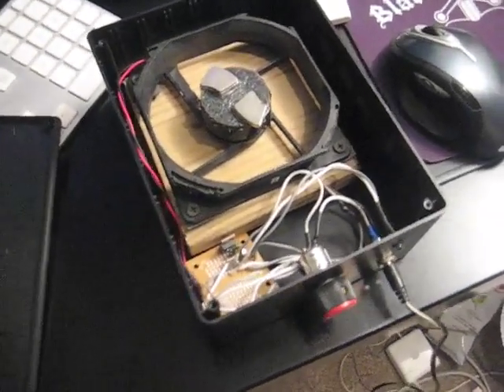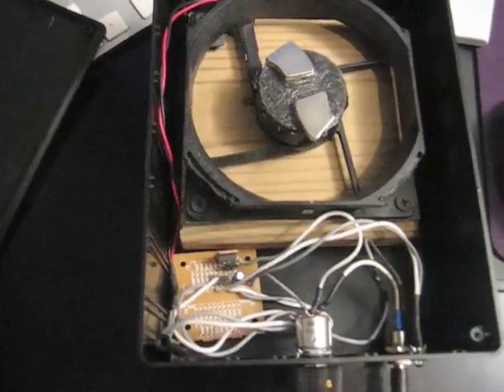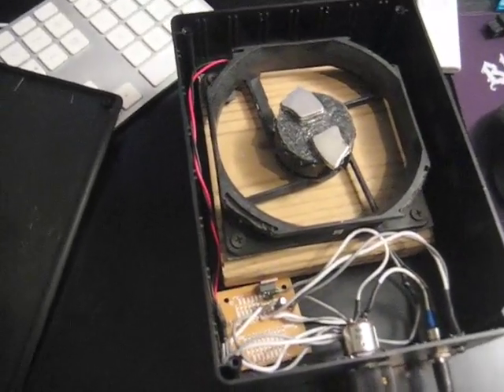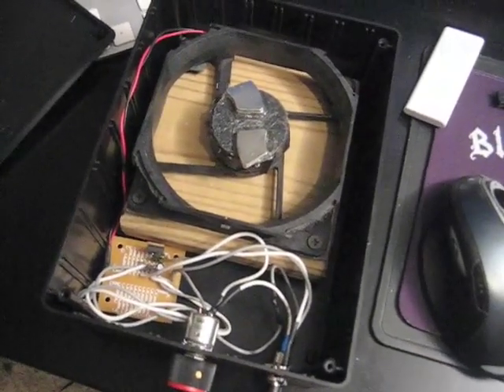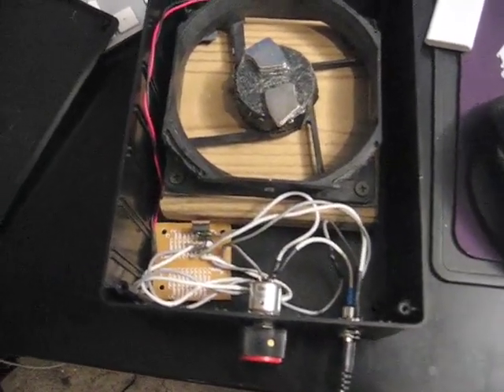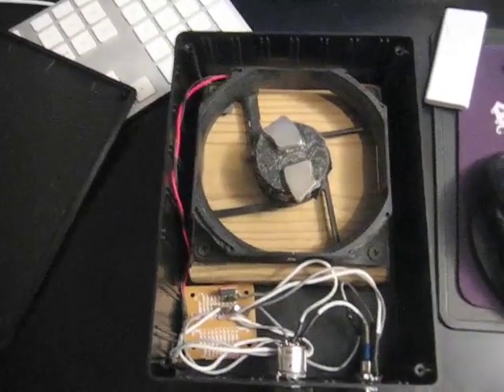This is pretty simple to build yourself. You just build a very simple — I believe it's an LM317 variable voltage circuit — and put it inside of this Radio Shack 270-1809 project box and wire it all up. I will put the schematics online anyway, and that's it.